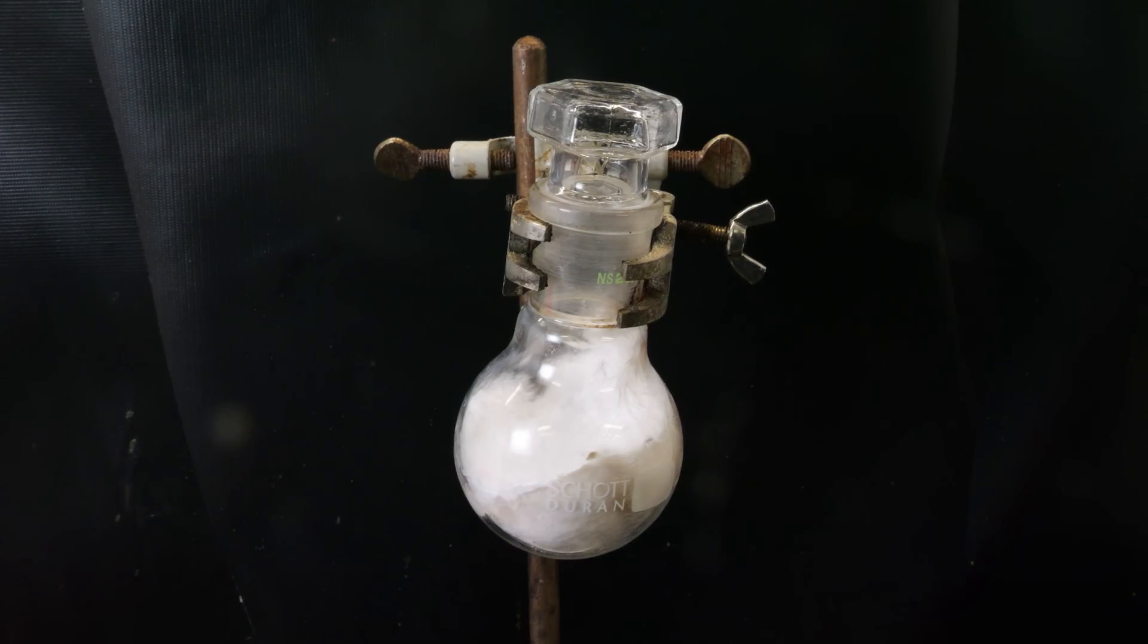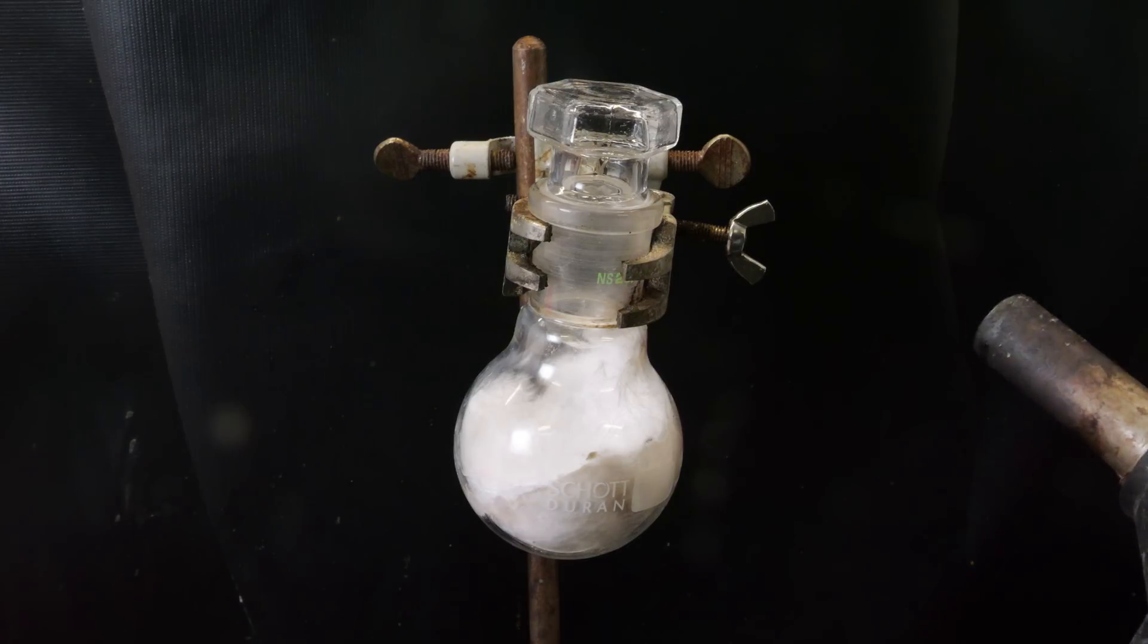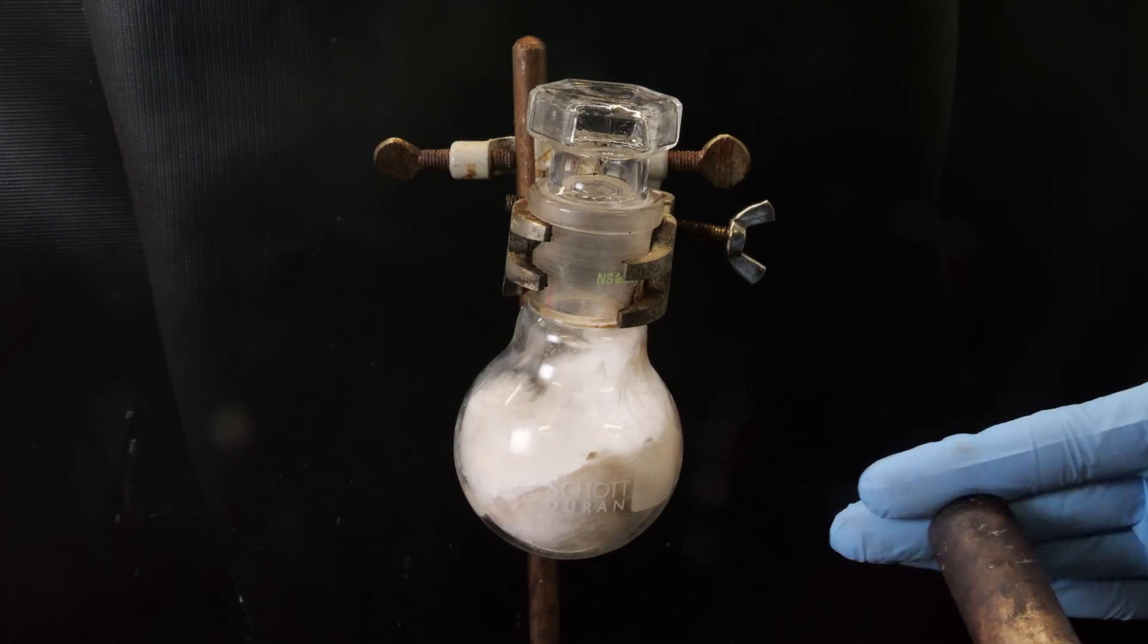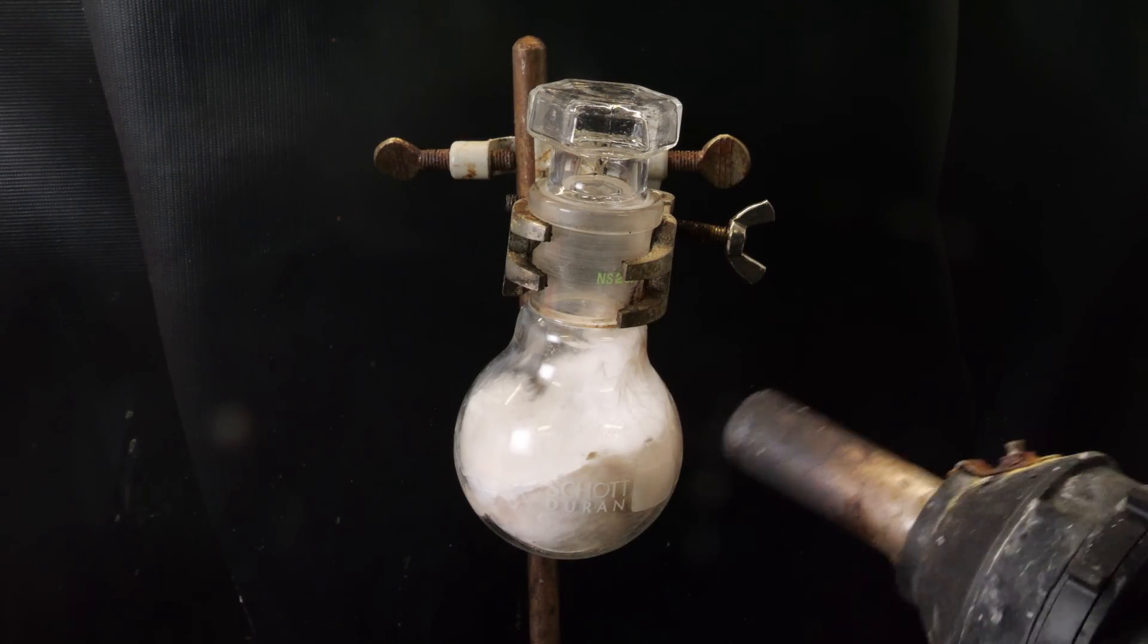I also tried to liquefy the sulfur trioxide again with a heat gun on very mild heat, but it didn't work. So I don't know how much I have exactly, but it's okay.